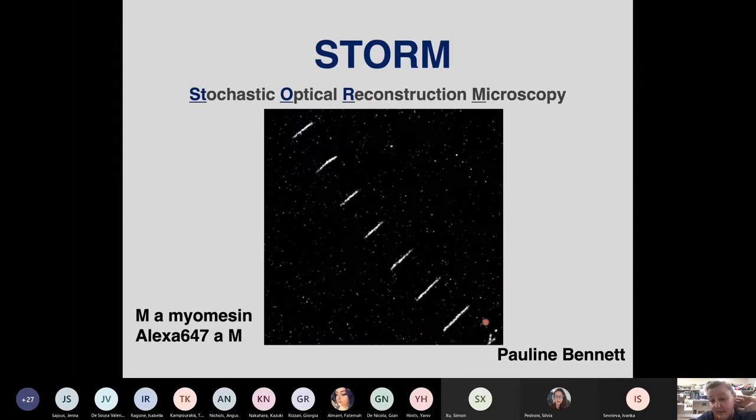And this is again an image set given to me by Pauline Bennett of some myofibrils stained and visualized in STORM. And this is my myomesin M-band antibody. And there's two things that you see here. One is that there's a lot of starry sky as well, so it's obviously some other blinking stuff going on. And the other thing that you see here is that this is a single labeled thing, so it's not nothing with quadruple or anything like that, because actually the only fluorochrome that will really be very, very reliable in STORM is Alexa 647. And so therefore, this is a definite disadvantage.